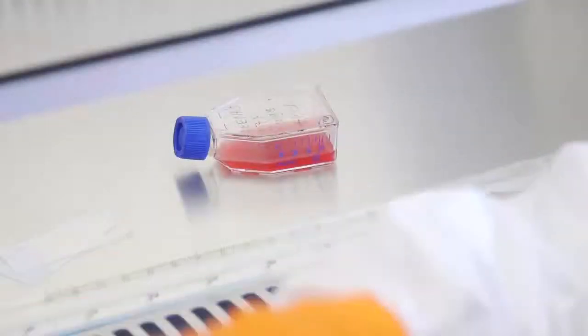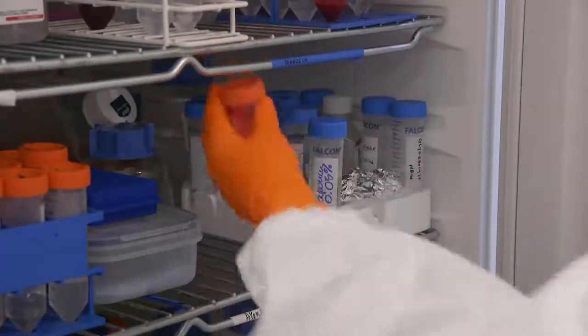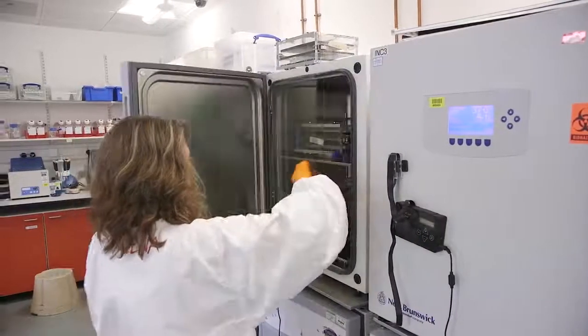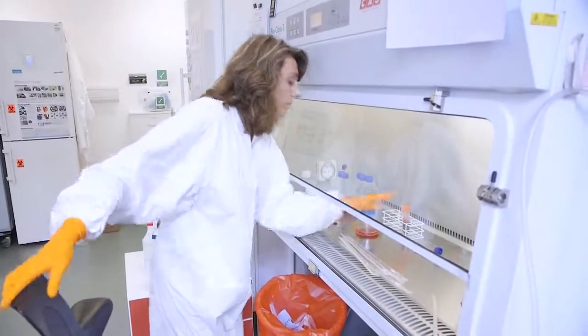We culture the parasite in plastic flasks and petri dishes using blood from the NHS Blood and Transfusion Centre. Malaria parasites need special conditions to grow in the lab: a specific mix of gas, a 37-degree environment to mimic the body temperature, and a fresh supply of blood.